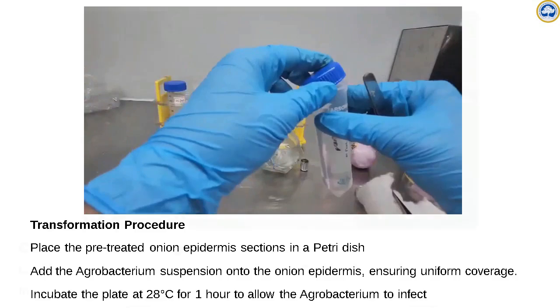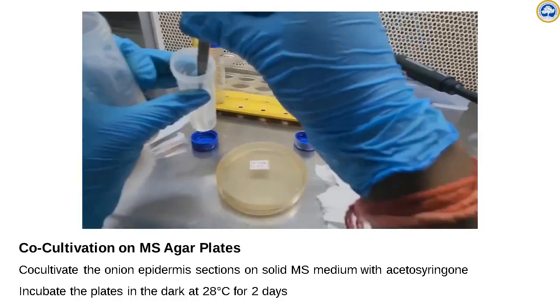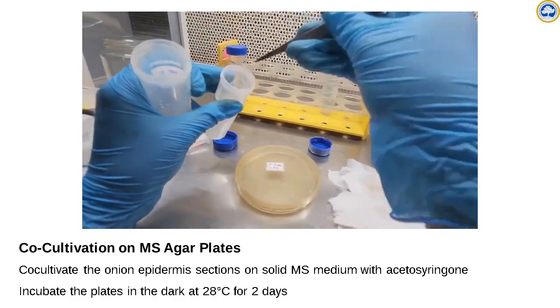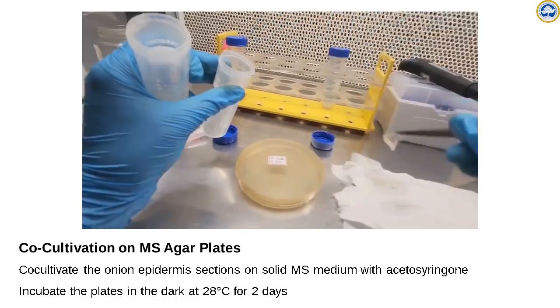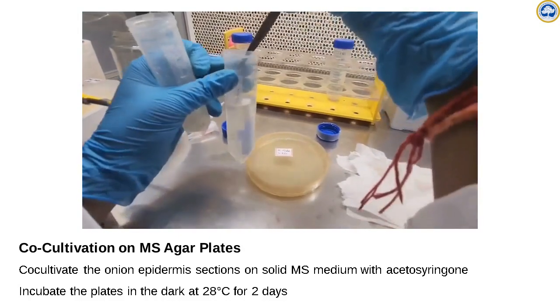For co-cultivation, we prepare LB plates or MS plates, preferably MS plates, with the required salt, sugar and hormones. You don't even have to add hormones.